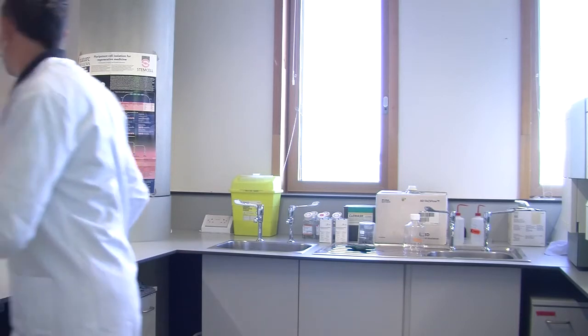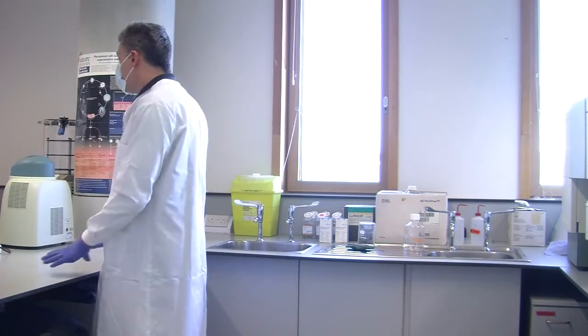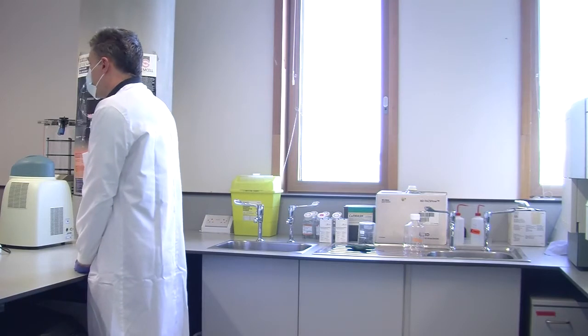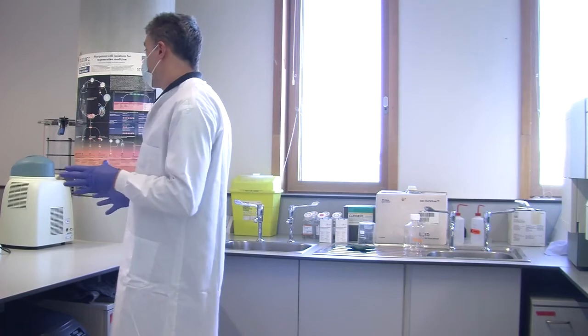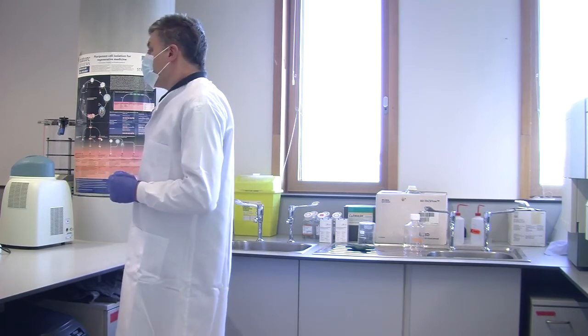Those markers, so the PE and the ones you just mentioned, are they typical, or are there more than one? Oh, there are thousands of fluorochromes. So how would you choose which is the best one?